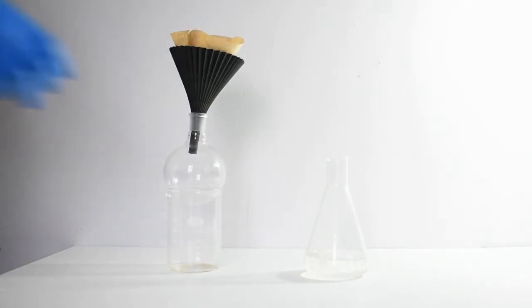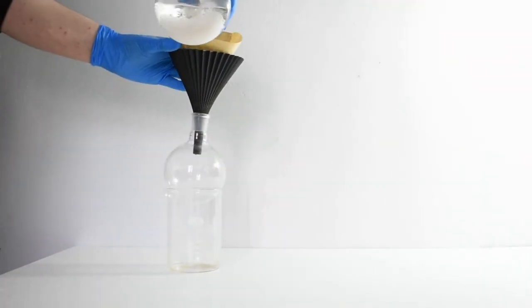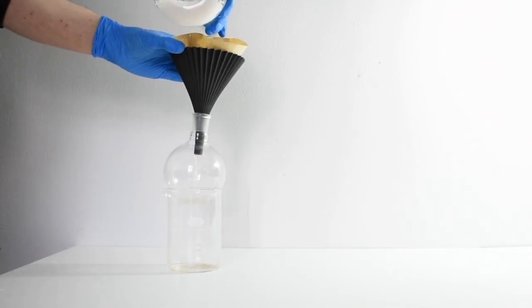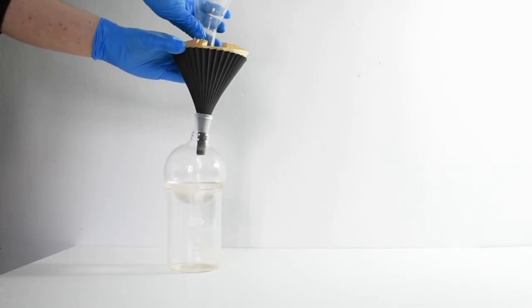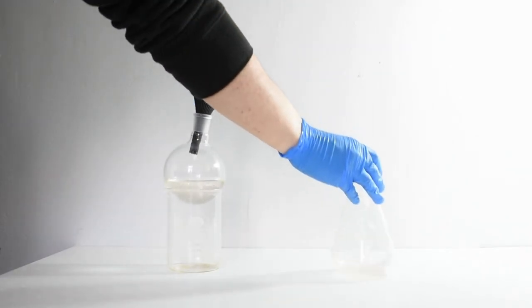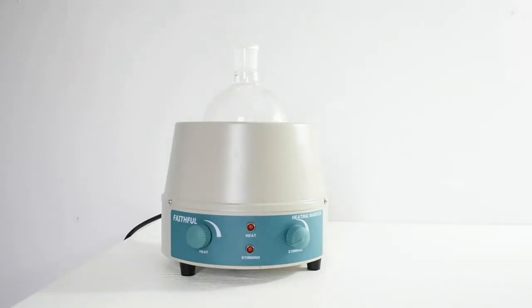The calcium chloride is then filtered off, and the solution is transferred directly into a round bottom flask. A simple distillation is set up to remove the dichloromethane solvent, but I'm going to do this outside because dichloromethane is not great to breathe in, and boiling this amount of dichloromethane indoors is not a good idea.